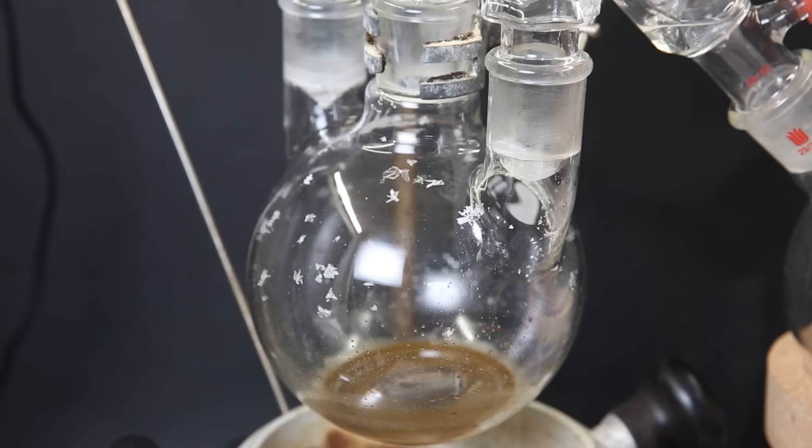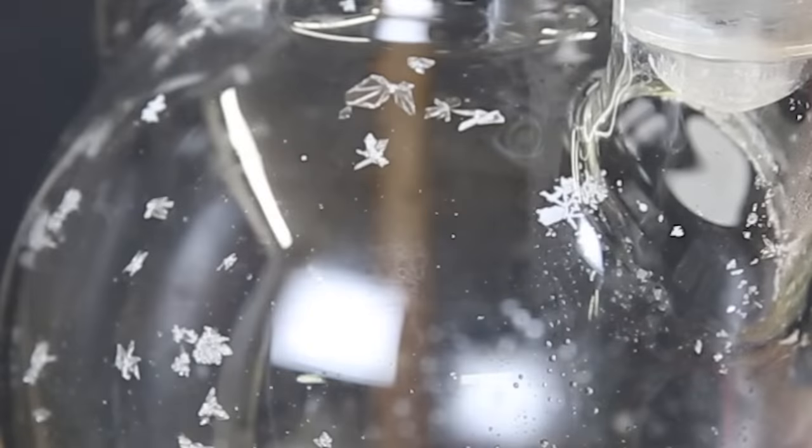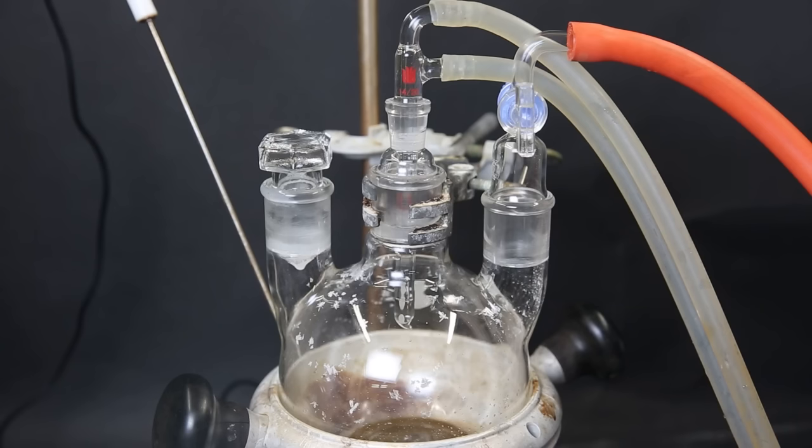I leave it overnight, and when that is done, I am left with a thick brown solid that melts at higher temperatures and some white crystals that have appeared on the sides of the flask. Since it is pretty much impossible to properly remove the crystals or remove the brown solid cleanly, I will have to try to purify it while keeping it in here. So as we have seen, even at the relatively low temperatures that the DCM was boiled off with, the solids still manage to sublime and collect on the sides of the flask.